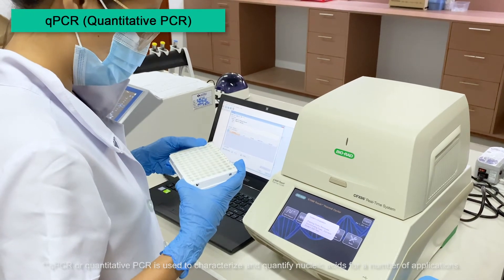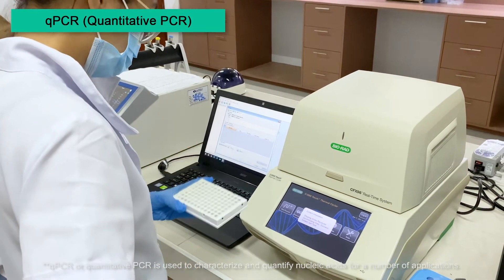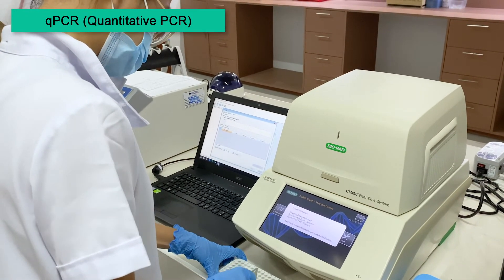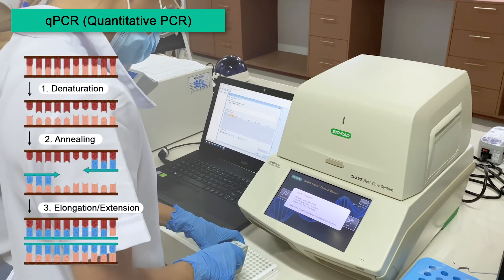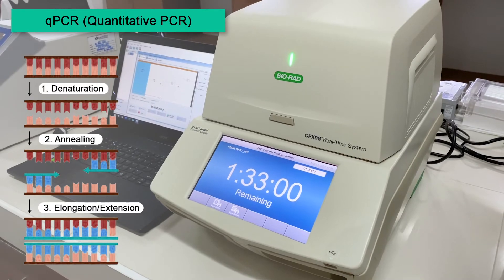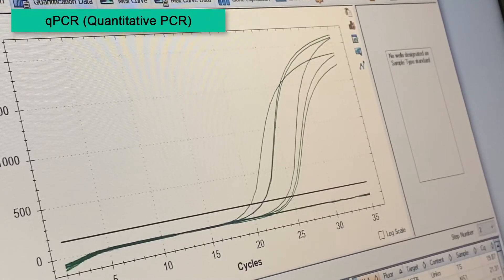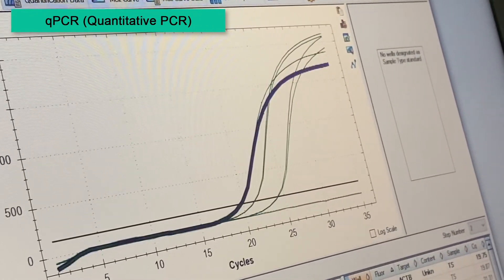After successfully generating the cDNA, a qPCR reaction can now be carried out. As in traditional PCR, DNA is amplified by repeating three steps: denaturation, annealing, and elongation or extension. However, in qPCR, the reaction progression can be monitored by an increase in fluorescence signal, and the amplification data is collected as the PCR progresses.